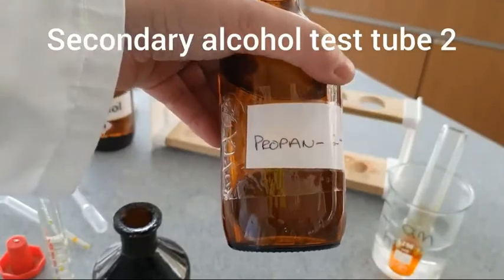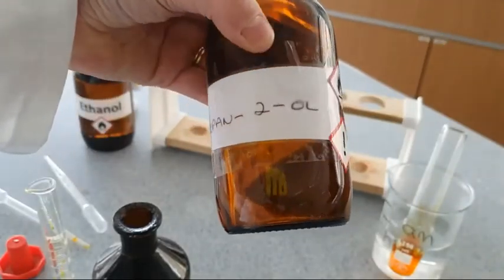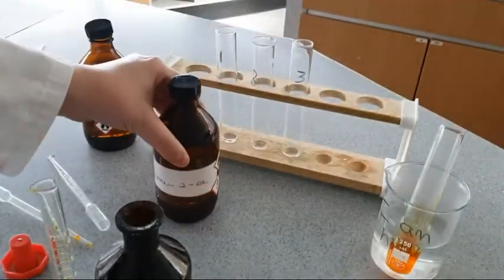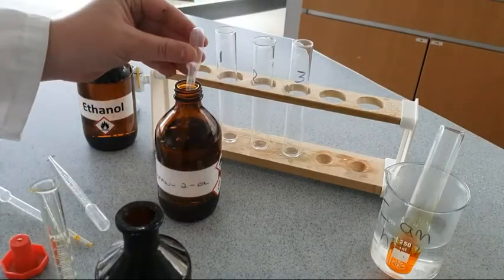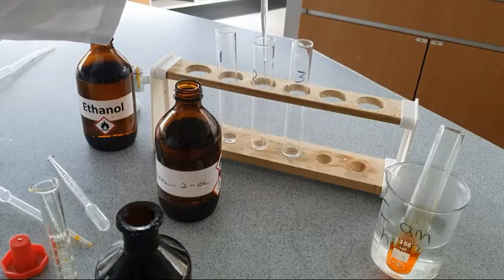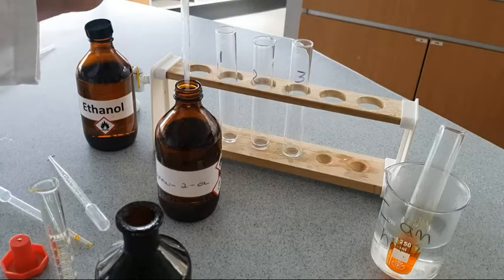We're going to also, in test tube 2, place a secondary alcohol, propan-2-ol. The carbon with the alcohol group has 2 carbon chains attached, so it's a secondary alcohol, placing that in test tube 2.